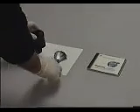Before opening the powder jar, give it a couple good whacks on your hand to loosen the powder, as it tends to settle when not in use.